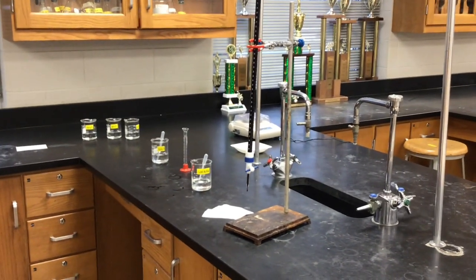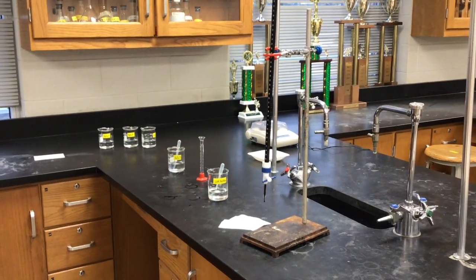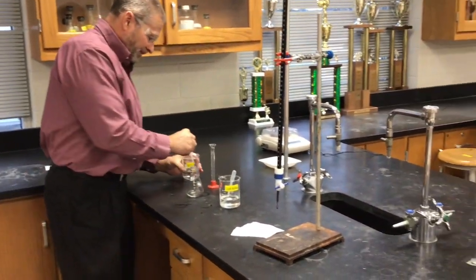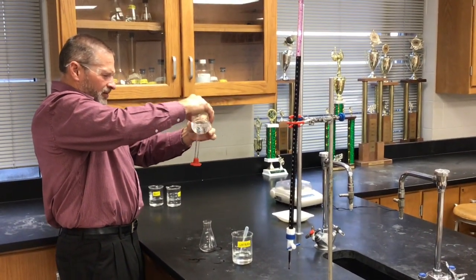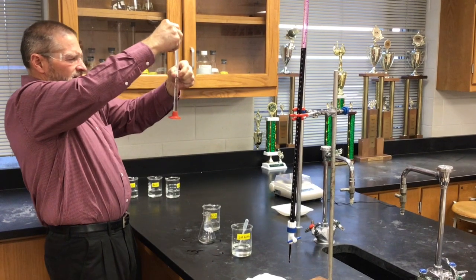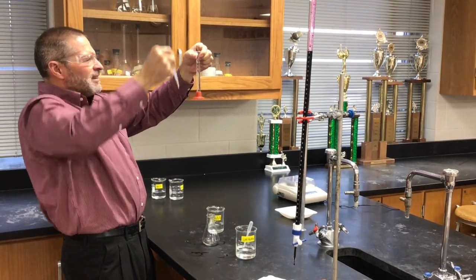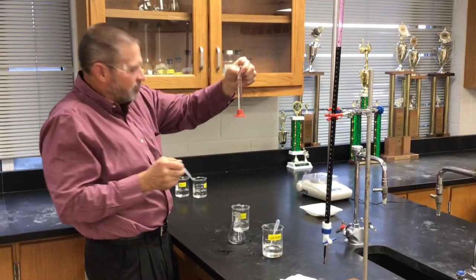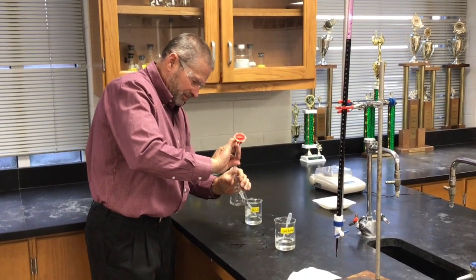So Mr. Hevel has done 2 good trials with A, 2 good trials with B, 2 good trials with C without overshooting. Pressure's on. Now you have 1 more, trial D, or sample D. Well, you know, Mr. Moore, if I overshoot it, it's not our grade. Yeah. What am I worried about? It's really not a big deal.